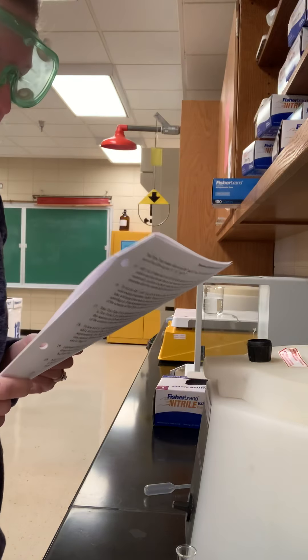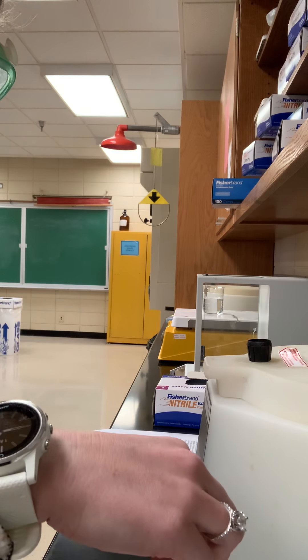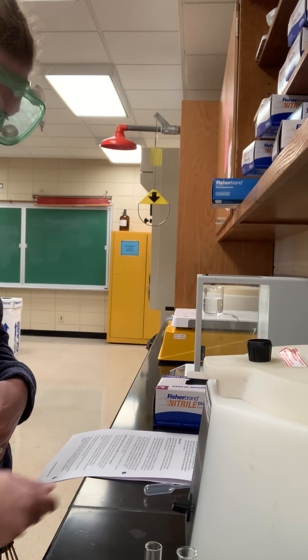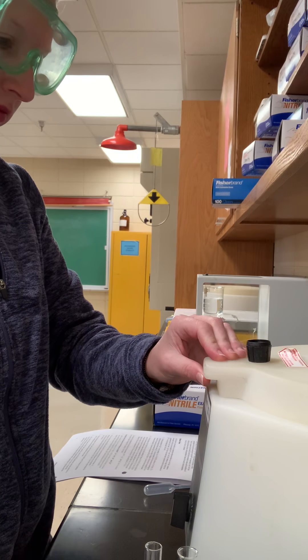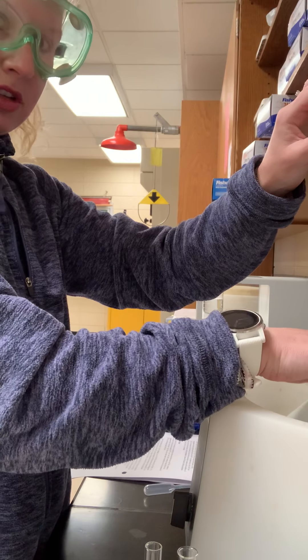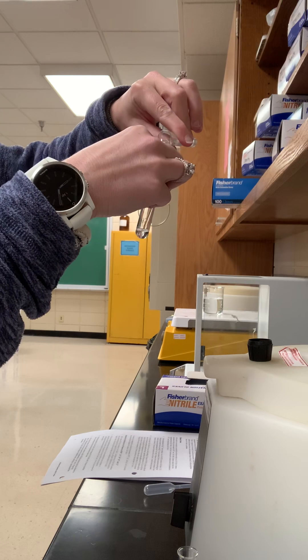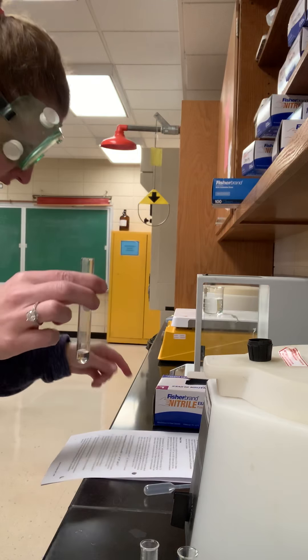While that's going, back to the procedure: centrifuge the hot liquid and quickly decant it into test tube three — so that means you have test tube three ready to go. Got it in my test tube rack, ready to go. Centrifuging is a process. All right, this is test tube one — let's pour this quickly into test tube three. It's still warm, I can feel it.